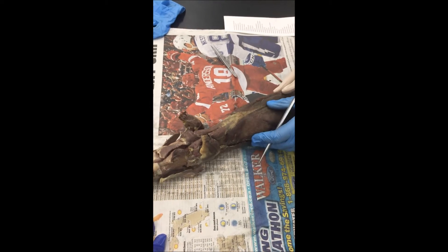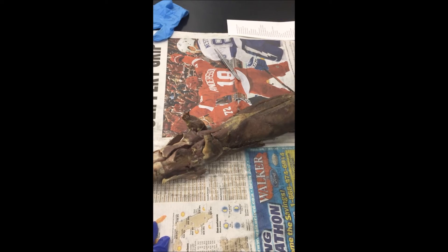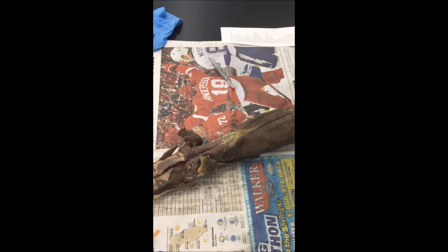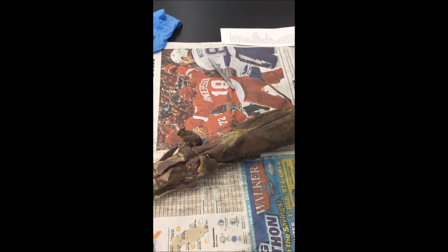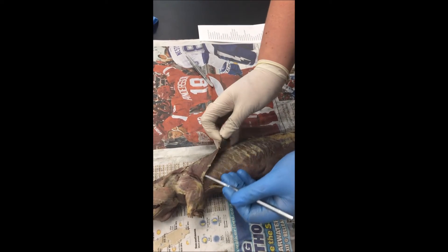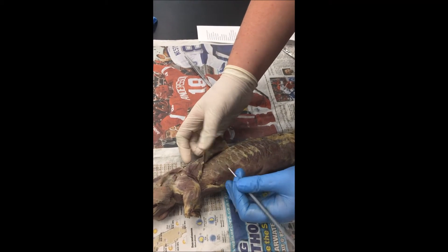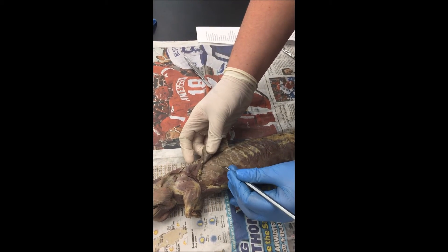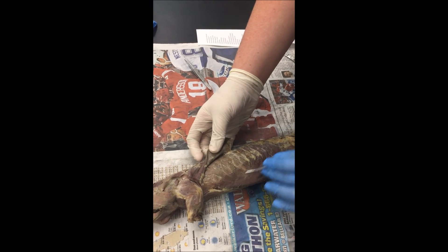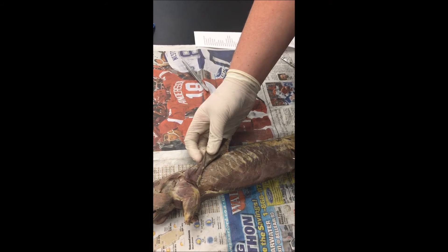Latissimus dorsi, and then the serratus ventralis, or serratus dorsalis, external oblique, internal oblique.